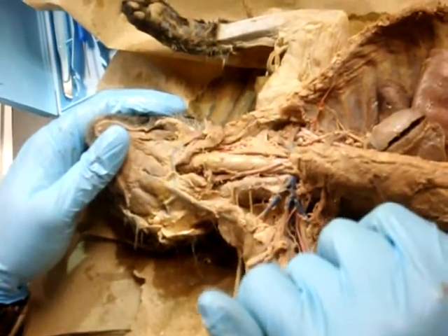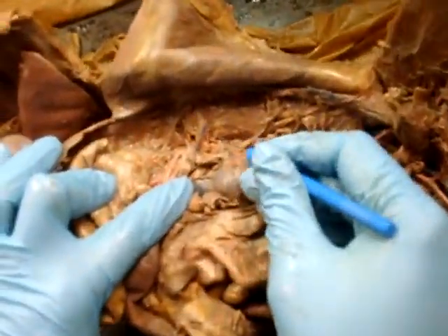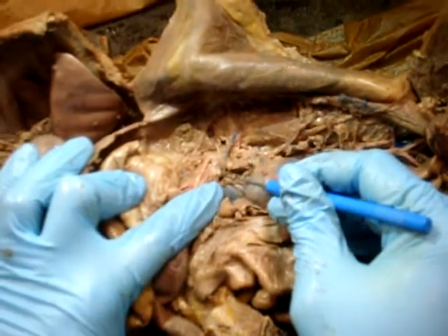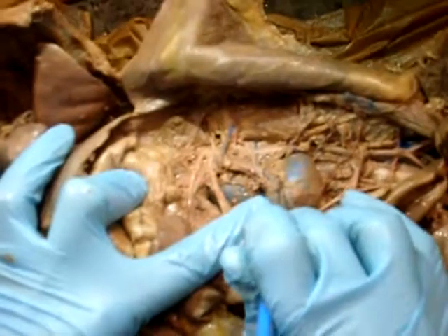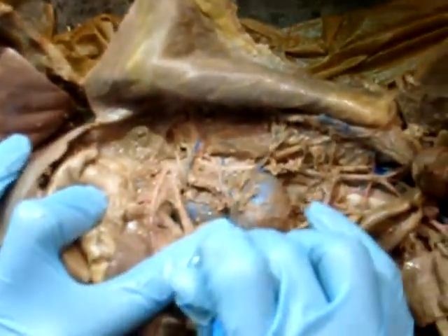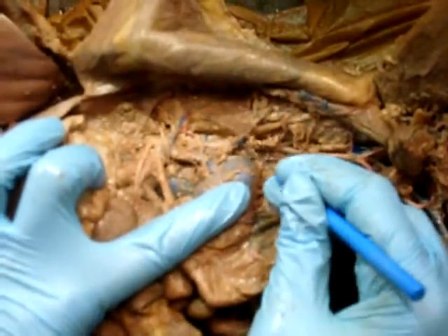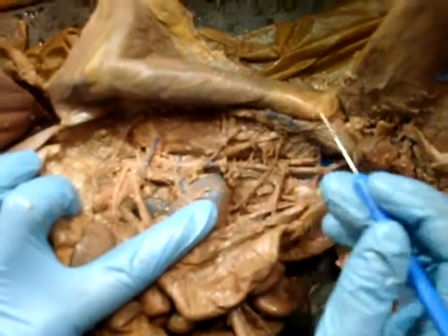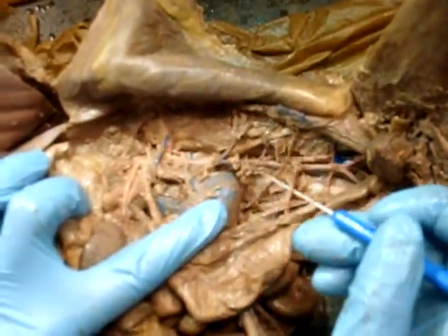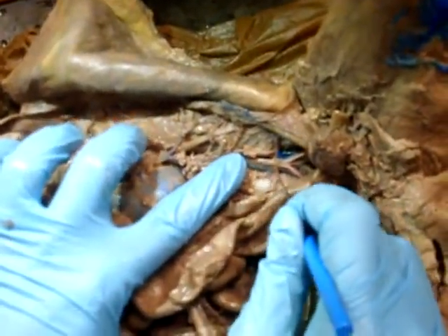Vessels caudal to the diaphragm, the vein. That would be here. Adrenal lumbar. That's this one right above the adrenal. See? That one's really obvious. Renal, also very obvious. It's the blue one going into the kidney, right there. Internal spermatic or ovarian. In this case, ovarian, that would be that one, right? Lumbars, going to the ovary. Lumbars, and then here's the iliolumbar over here.